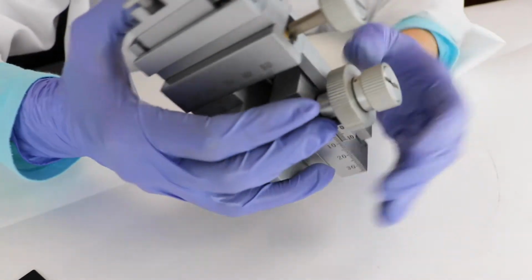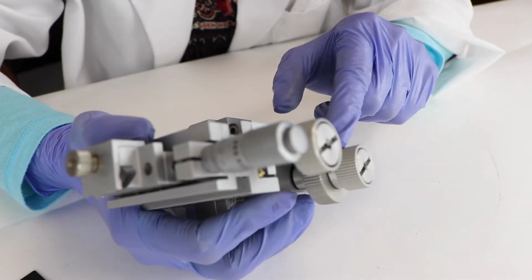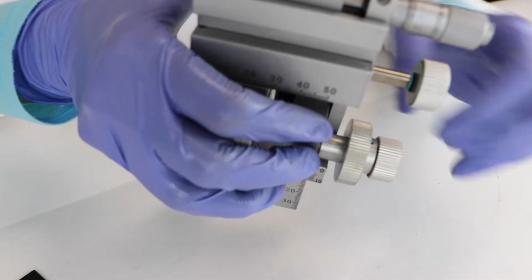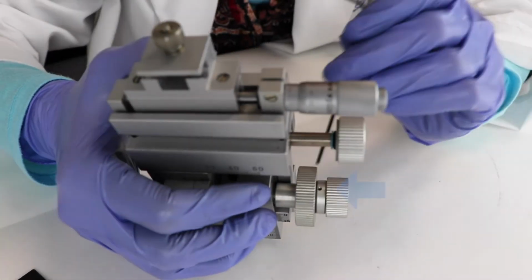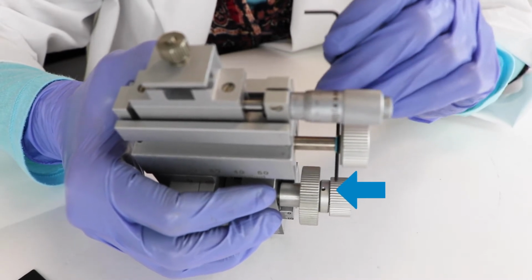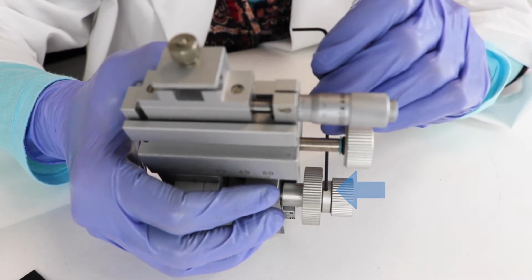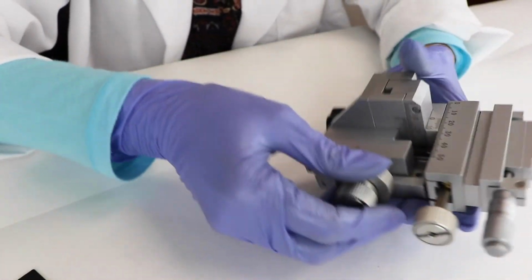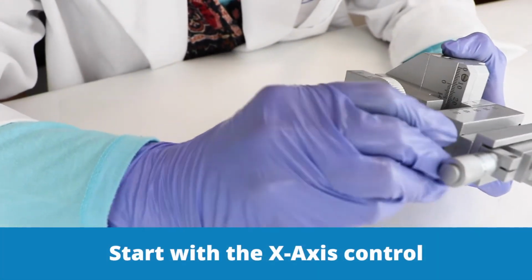And inside here, you see an adjustment ring. Okay, right there you see the adjustment ring inside. There's a little tiny hex screw right inside there we have to adjust. All right, so to do this, we're going to start with the x-axis control.